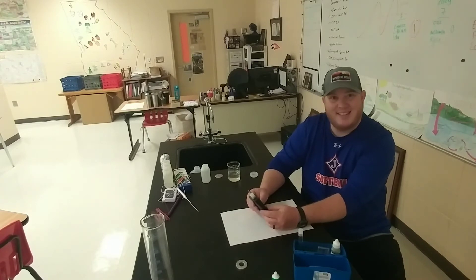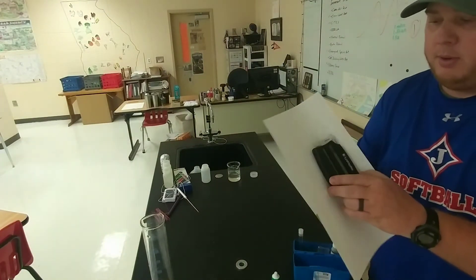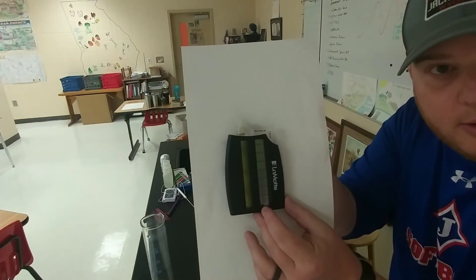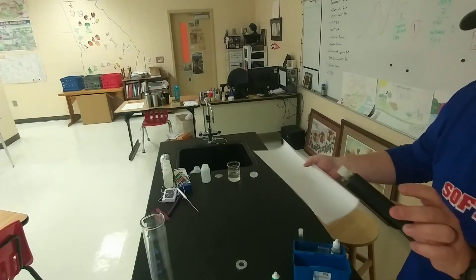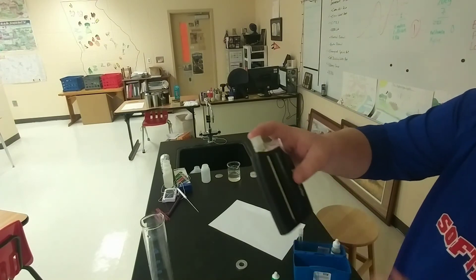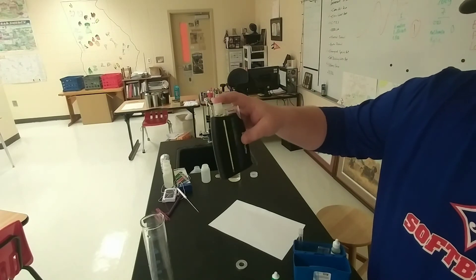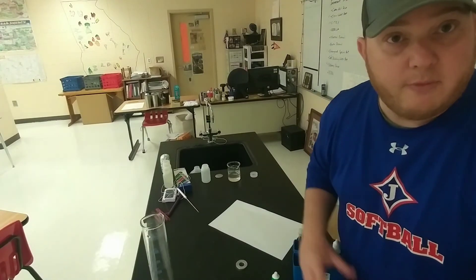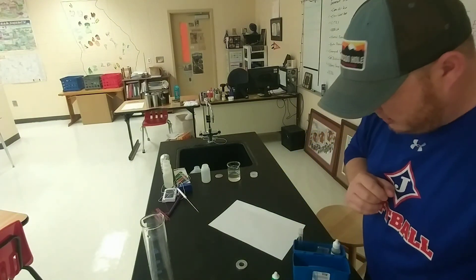It looks like right at seven. I've tried to put it on the back of a lighter piece of paper but it's right around seven — could be a little bit greener than seven, and that little extra green indicates 7.5. So I'd say it's somewhere in between seven and 7.5, which matches what we got from our field test. We'll go with 7.3 as our pH. See you guys for the next test.